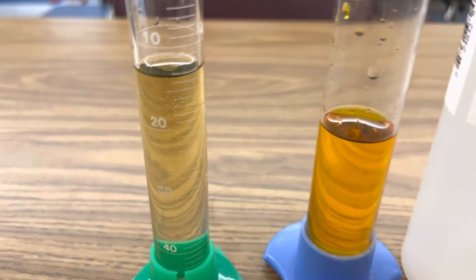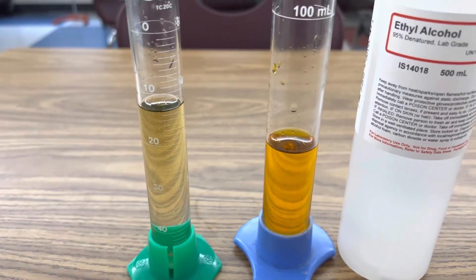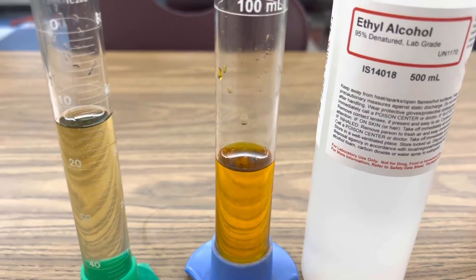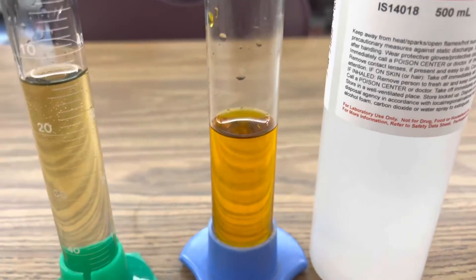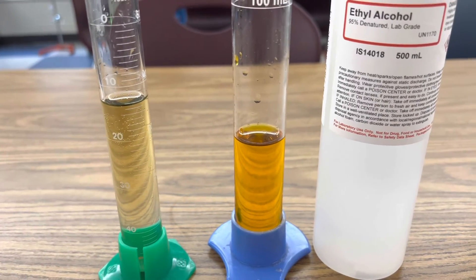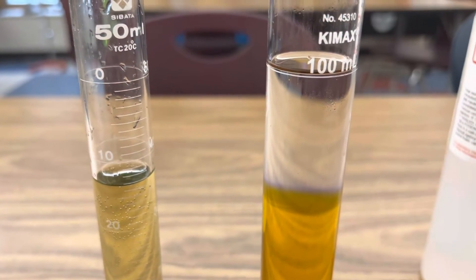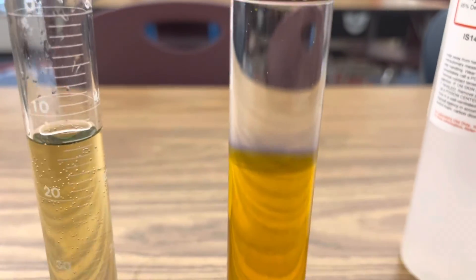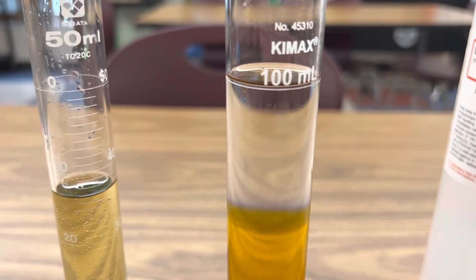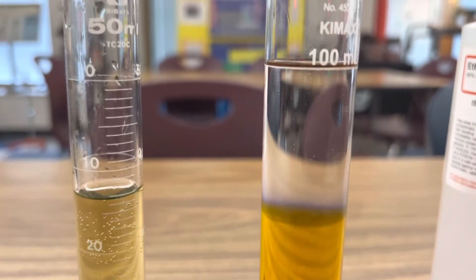You can see my chromium peroxide — that deep blue — is almost completely decomposed. If I want to maintain that blue color, I'm thinking to add a little bit of ethanol to the top of my potassium dichromate solution. Since it's less dense, it'll just float on top and it will maintain that deep blue chromium peroxide above it. So I'm just going to pour a little bit of ethanol, and now you can see the ethanol suspension is just on top of my slightly acidified potassium dichromate solution.